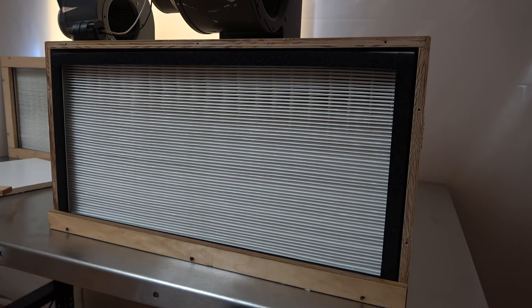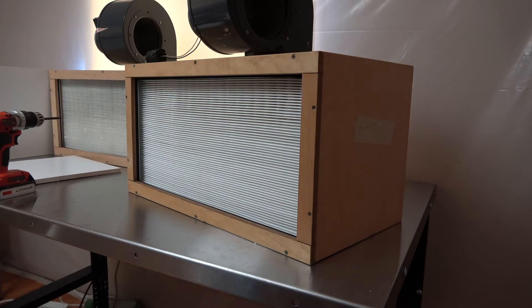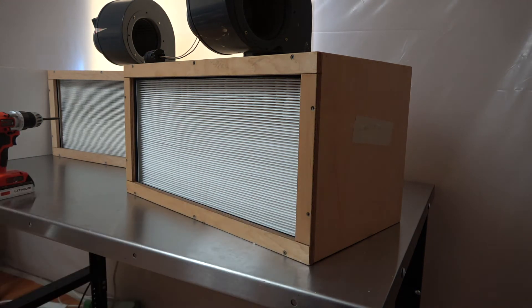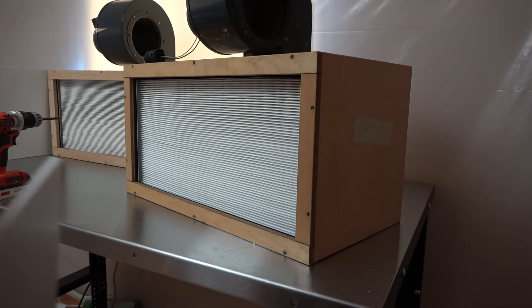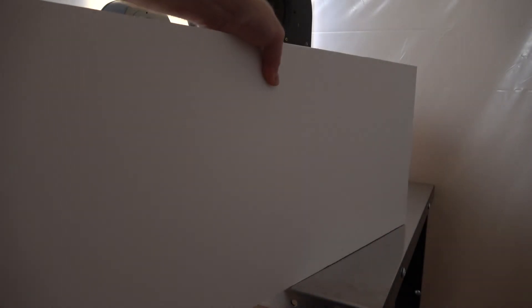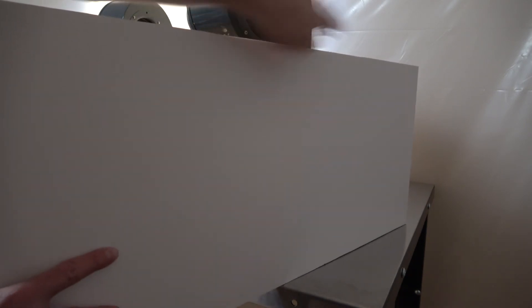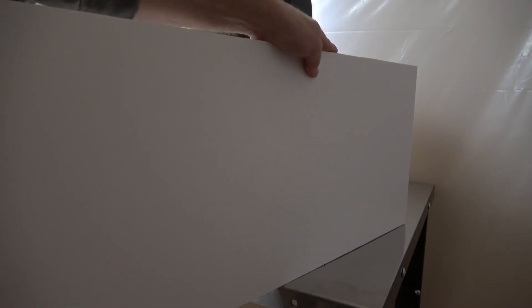Once I start cleaning this area up in the lab, I can get to refreshing some culture slants. Be aware that when putting the walls back on, you don't run screws into the filter. Make sure you only put screws on the back half portion of your flow hood — four or five of them should be enough to hold it nice and sturdy. Maybe put one short fat one towards the front to keep it stable, and that probably won't cause any problems.